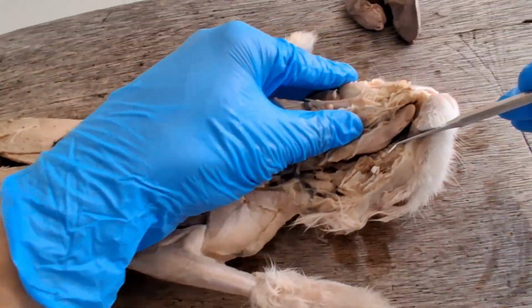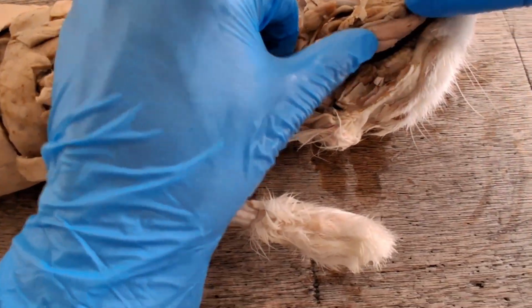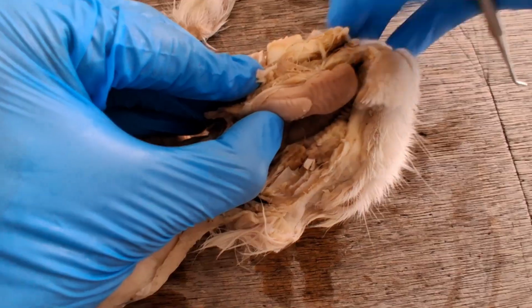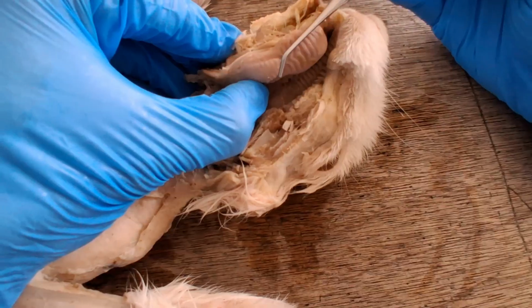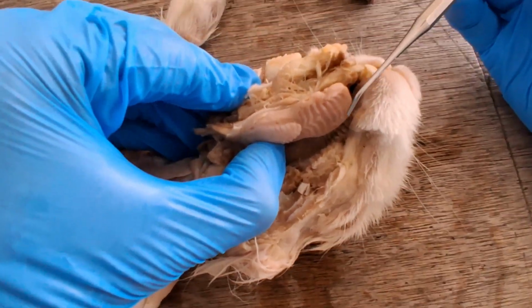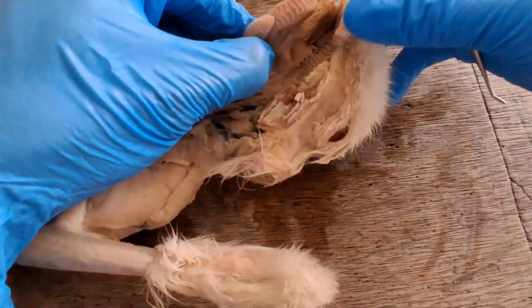And then if you open the oral cavity, so this is the mouth or oral cavity or buccal cavity, this would be the tongue. It has a softer anterior portion and then a slightly harder posterior portion. So the tongue is equipped with papillae, different types of papillae. So just read your textbook, Hyman, for the different types of papillae which are equipped with taste buds.